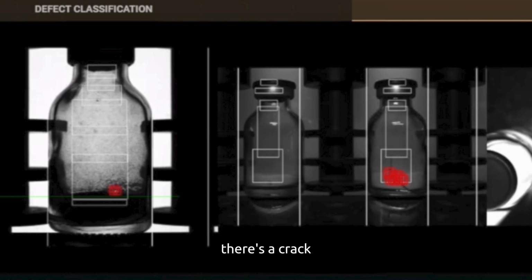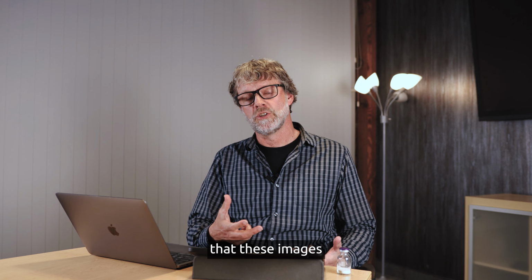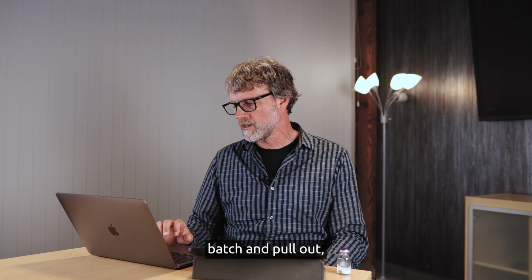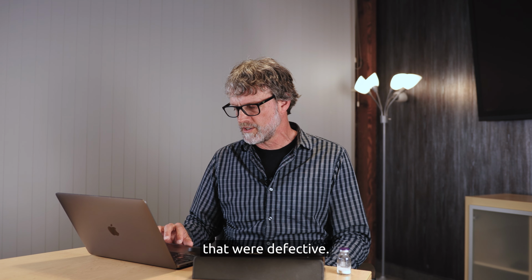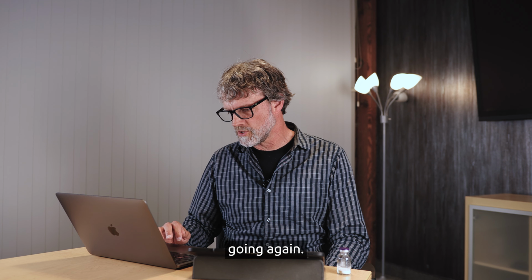We can see that there's a crack on the S camera. We can see a very large crack on the S camera, and it says gross defect because the Avis looks at this as a very gross defect, a large defect. You can also see in the red marking where to look on the image when a defect comes up into the HMI. Now it's also important to know that these images are being stored in the audit trail, so you can go back after a batch and pull out the vials that were defective and know what the defect was in particular. So I'll start this going again.